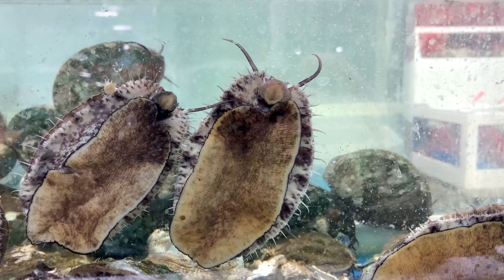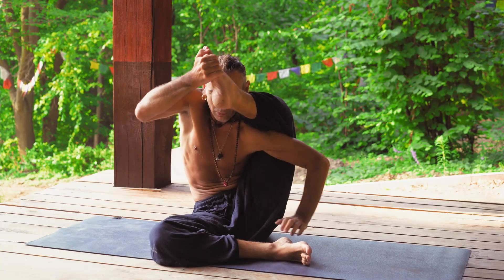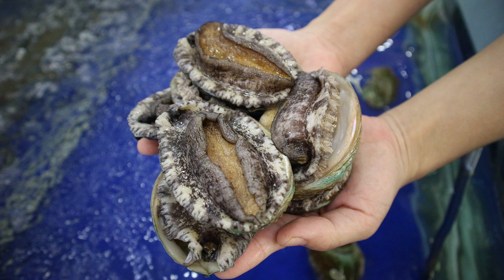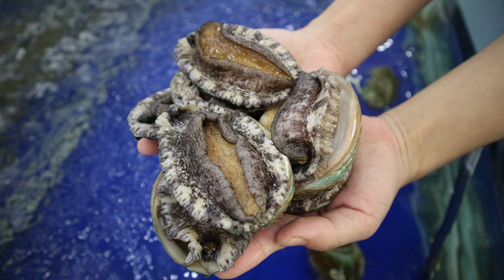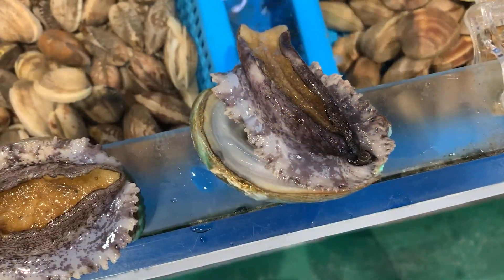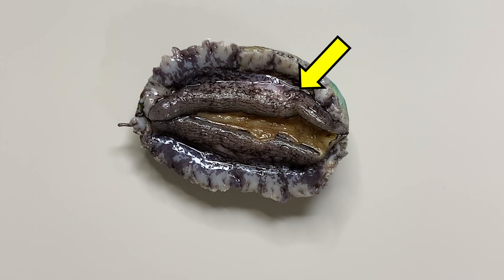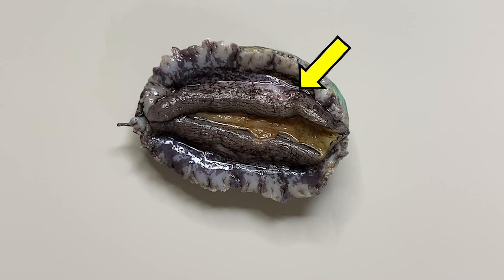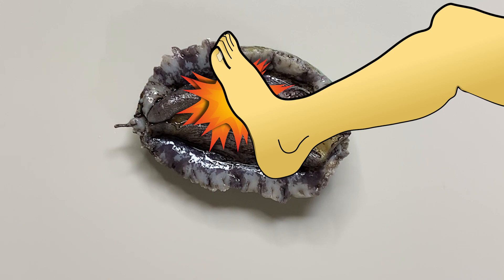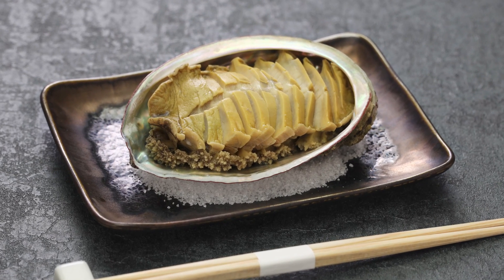Abalone is a creature belonging to mollusca. Most molluscs have a muscular foot. So where is the foot of abalone? Abalone is a gastropoda whose foot is located in the lower part of the guts. This part, widely located at the lower part of the body of the abalone, is the foot. The main part we eat is the foot of abalone.